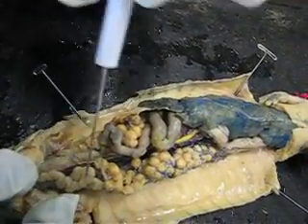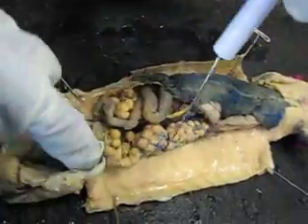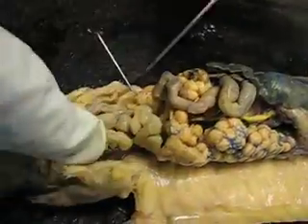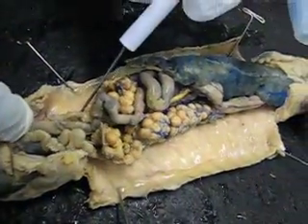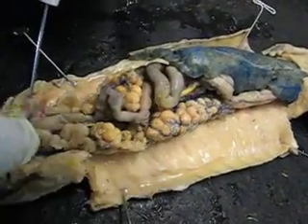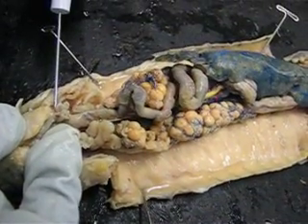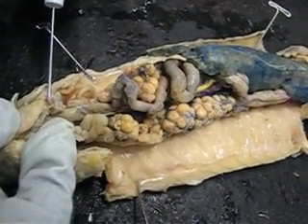On either side of the large intestine we're going to see the kidneys, which are these dark structures right here on either side. The urinary bladder — you can't really see it that well on this one, but it's going to be right here.